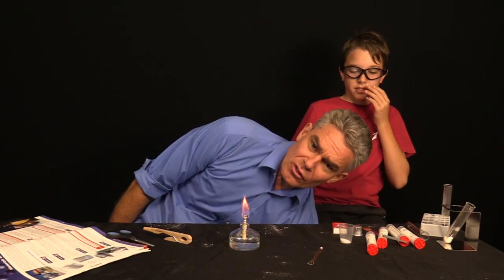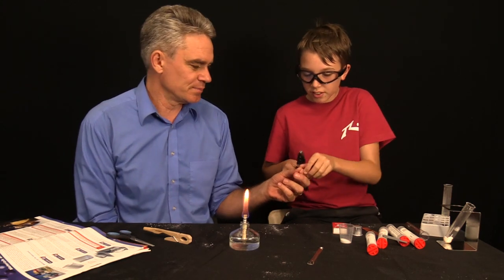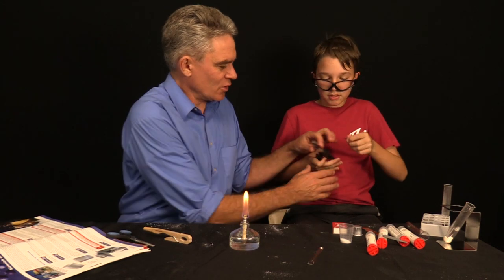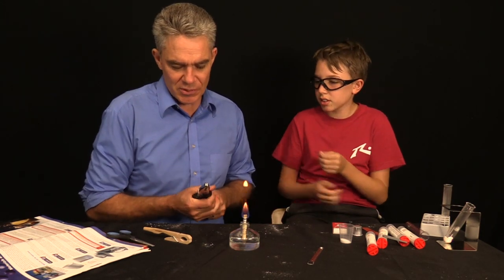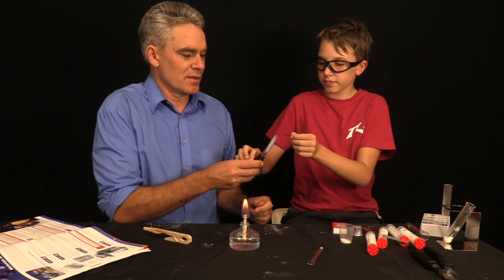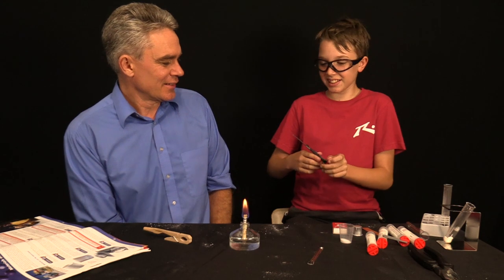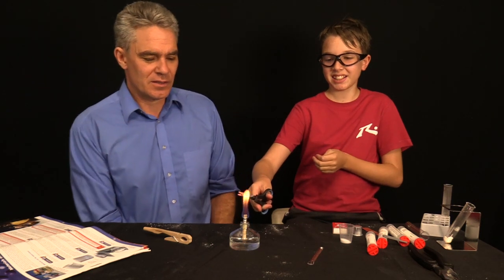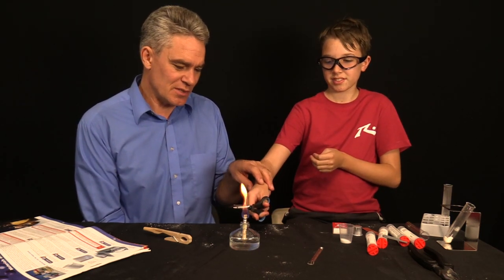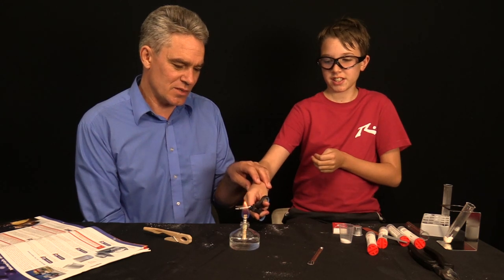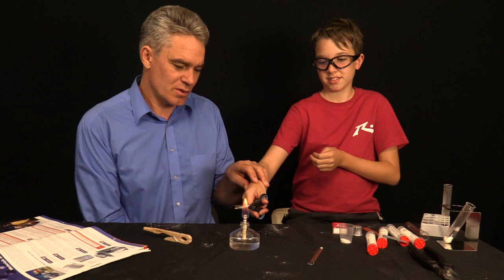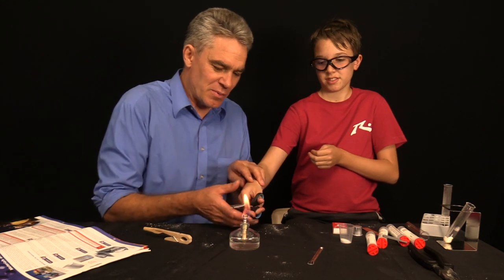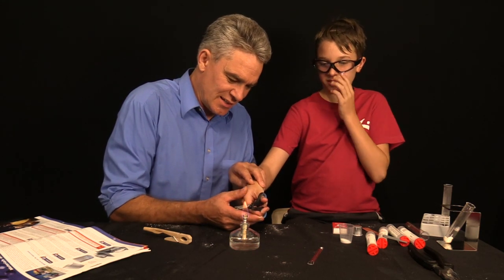He'll hold it with the pliers and he will ignite the magnesium ribbon. If he doesn't drop it on the ground. Here we go. You've got these pliers. You're saying they don't close properly. Okay. Hold the ribbon in the scissors then. But don't snip it. A little bit of pressure, but not too much. Here we go. He's going to... It's going to be bright. It's going to be bright light. It's not the hottest flame, is it? Let's hold it about there. Here we go. Almost there. Come on.